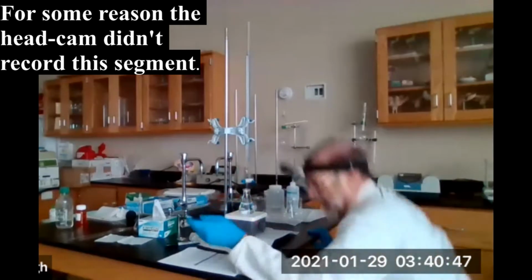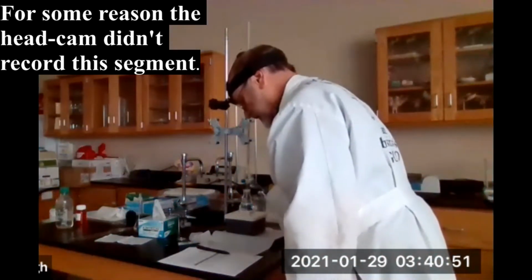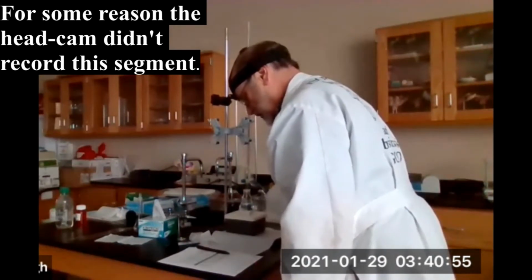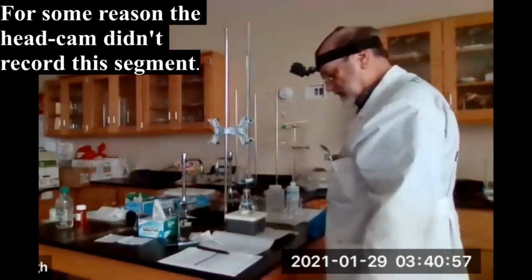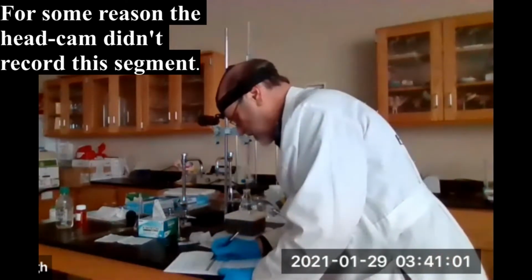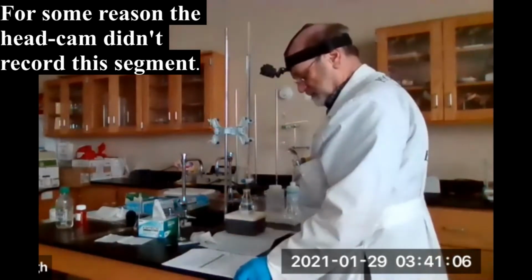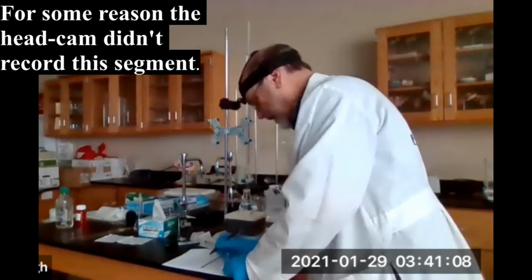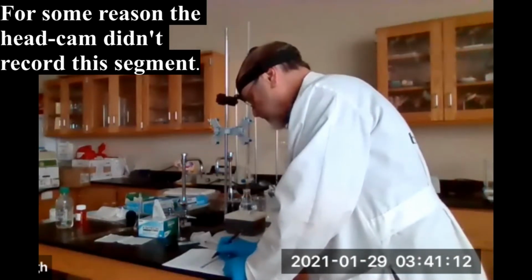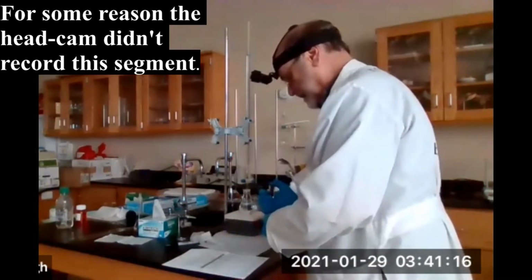Yep, so we can average those values actually. 0.675, 0.675 we'll use as our value. Yeah, that's probably not fair. 0.65, we thought we might have overshot. Let's use 0.7. We just go with 0.7 milliliters.